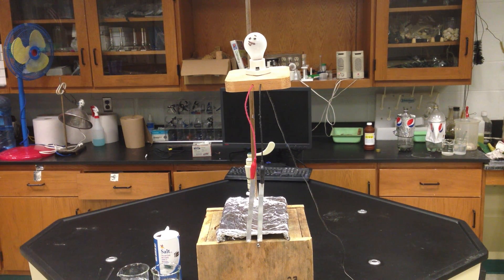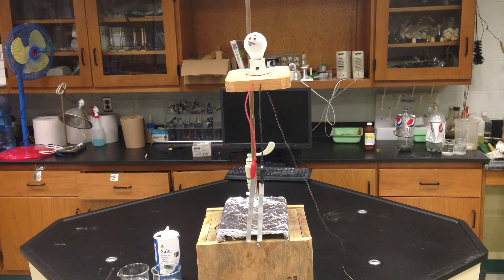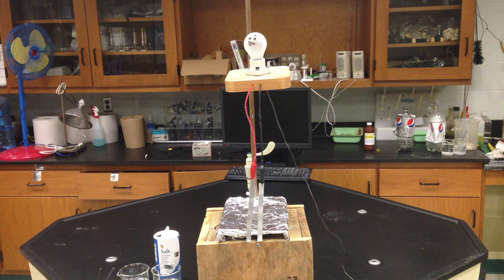In this demonstration, I'll be showing you one of the most important properties of ionic compounds, and that's their ability to conduct electricity in solution. That's why we call them electrolytes.